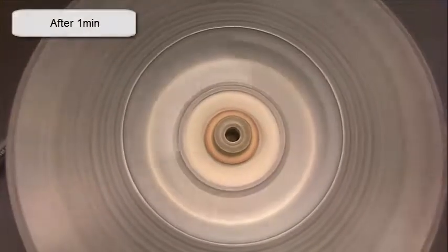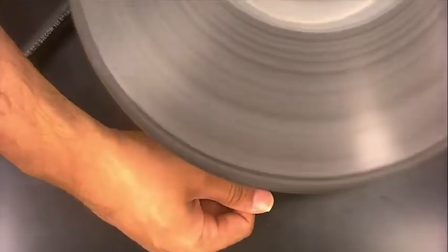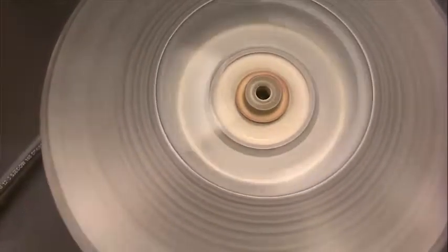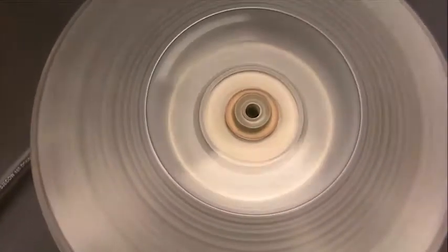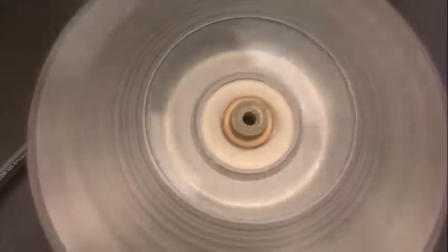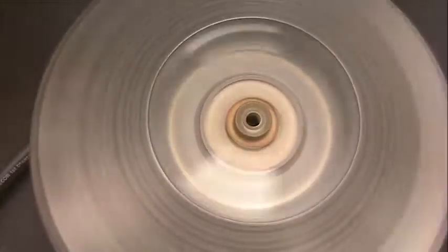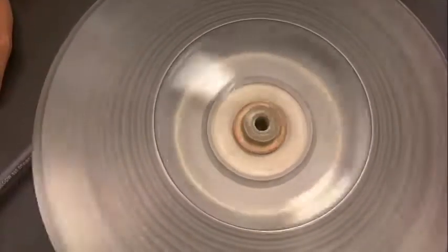Let's say one minute has already elapsed. I'm going to turn off this switch. And let this stop on its own devices. Don't try to stop it with your finger, or with a paper towel. Just let it go and stop on its own. It's a high centrifugal speed that's going to collect the precipitate.